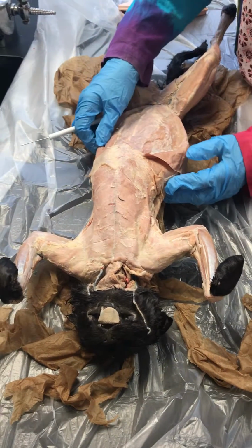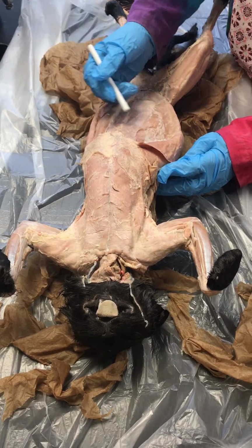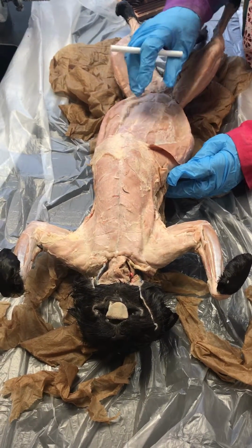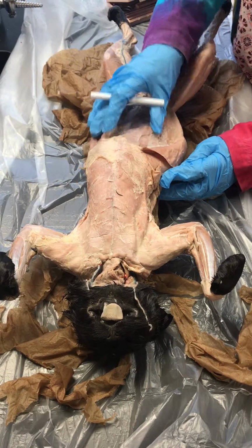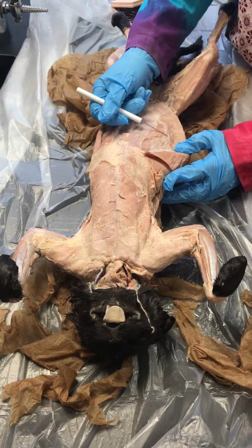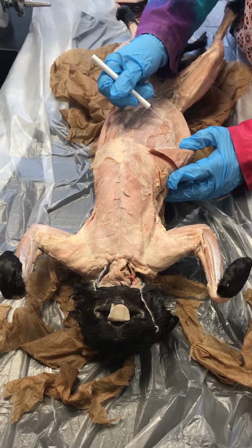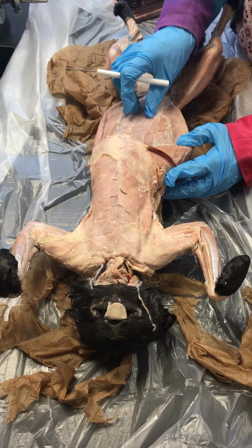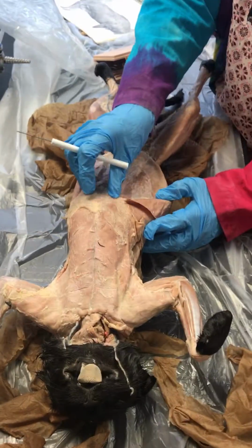Now, in a lot of your cats, as I walked around the room, it was really hard to see the transversus abdominis because you have all of this, and I will definitely ask this, this area is called the aponeuroses, that big tendon sheath. So that aponeuroses sits over all the rest of the muscles. But the transversus abdominis actually is this one right here. It runs in underneath the internal oblique and into the rectus abdominis. The rectus abdominis sits right in the middle of the abdomen.